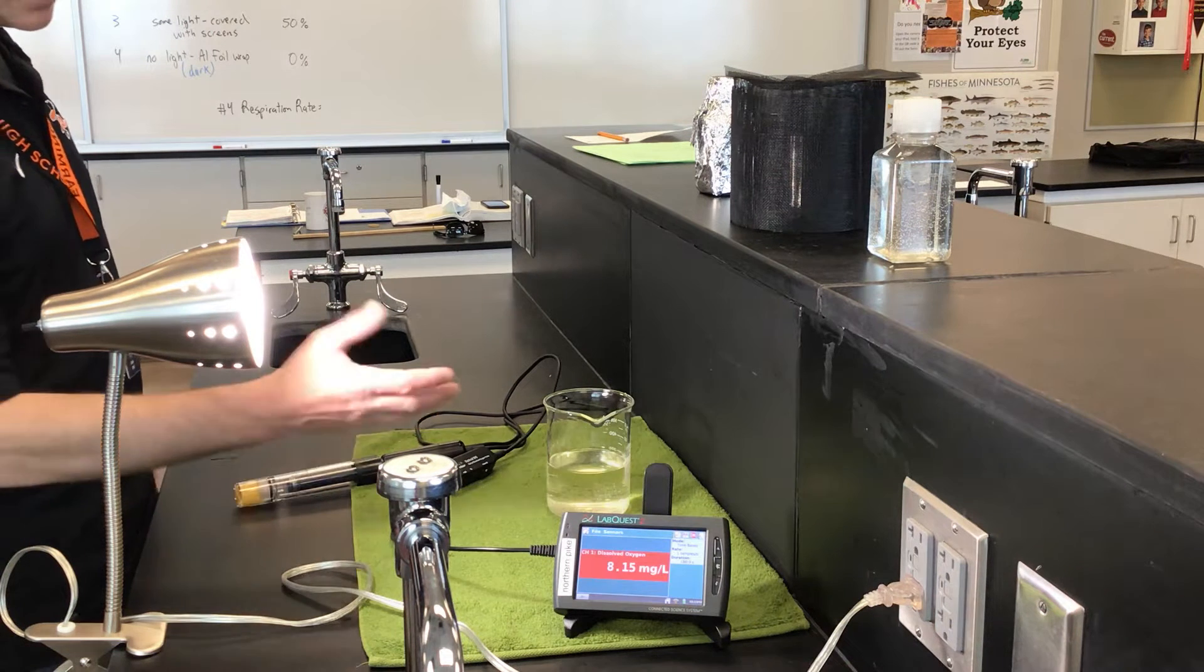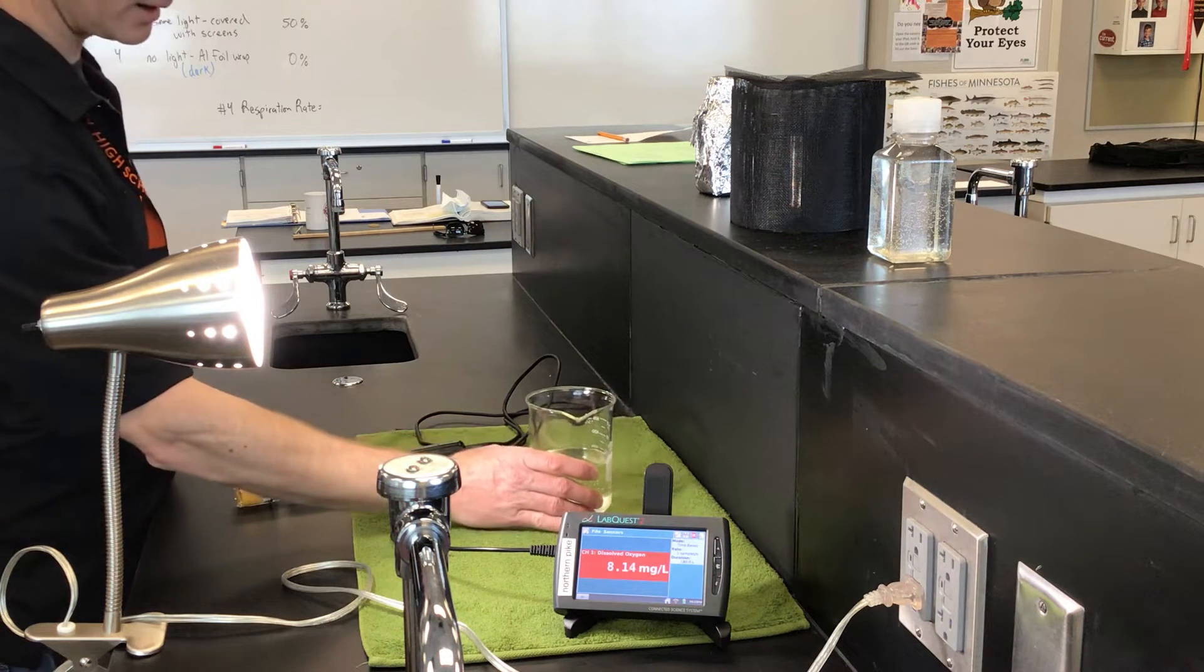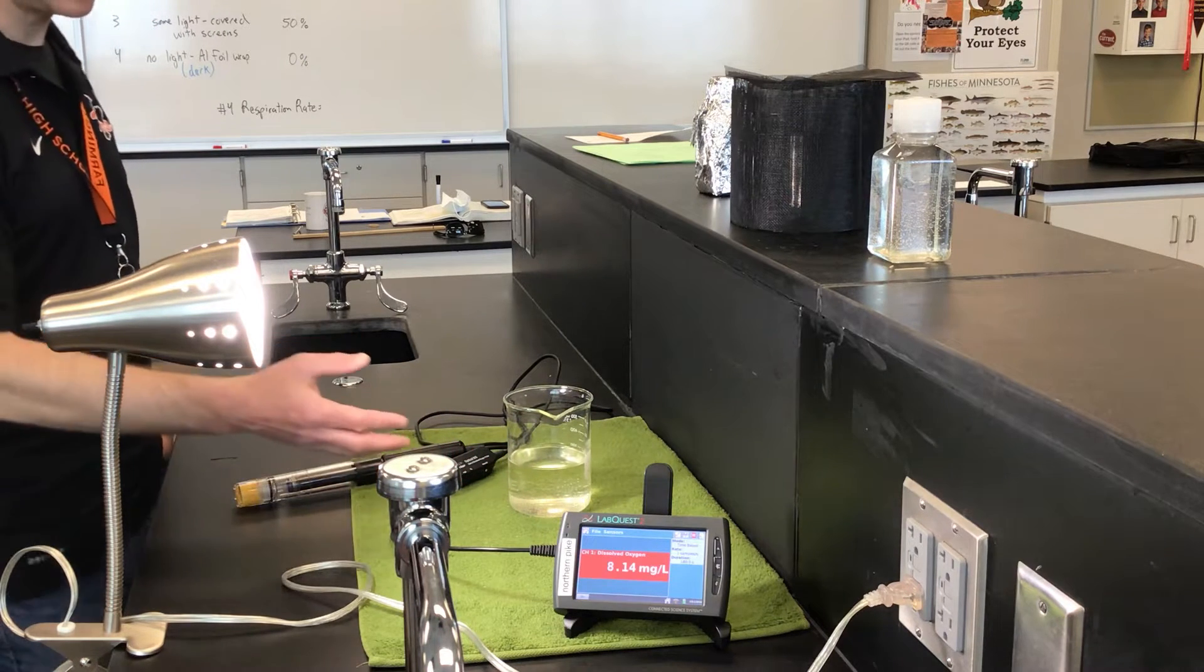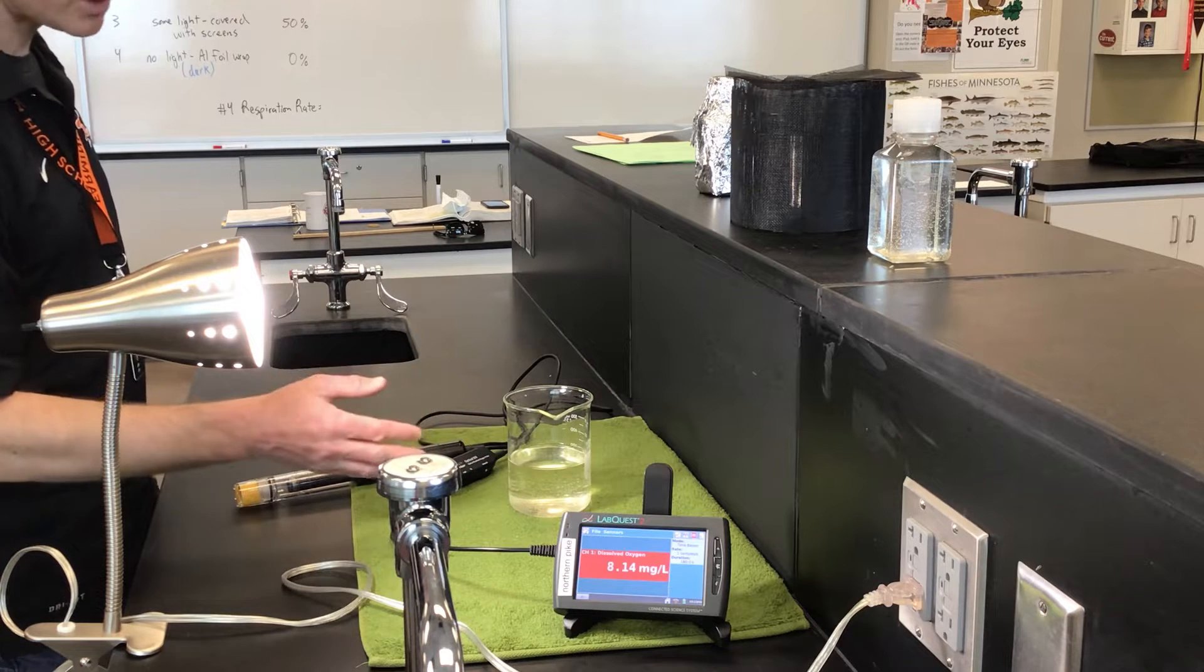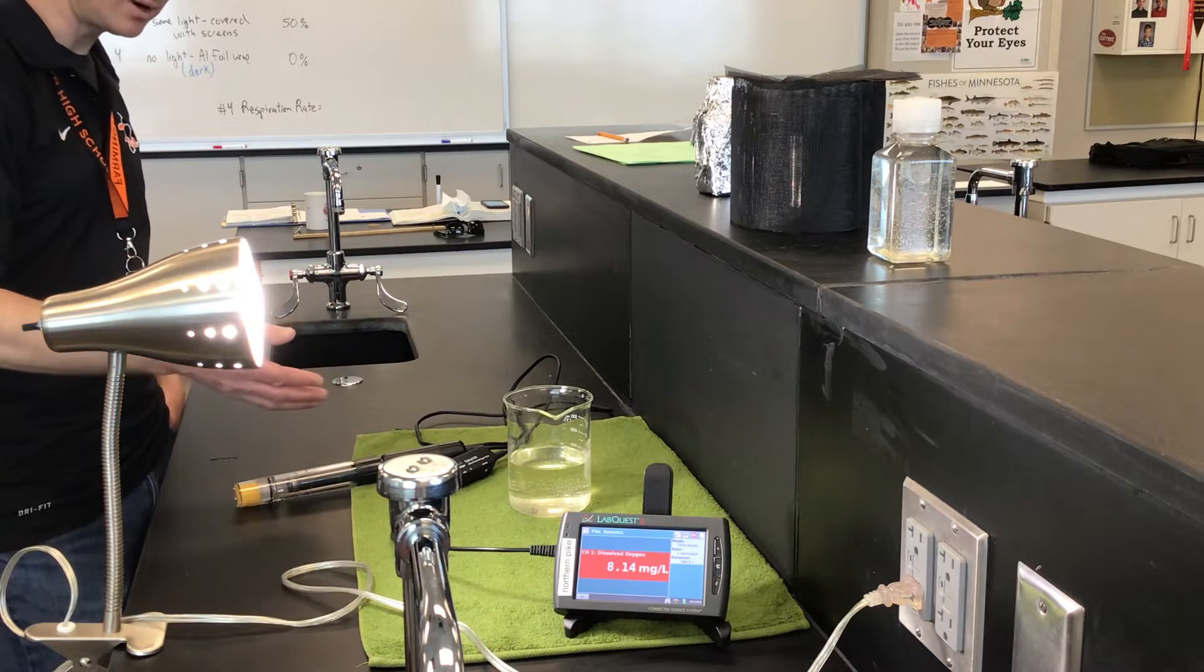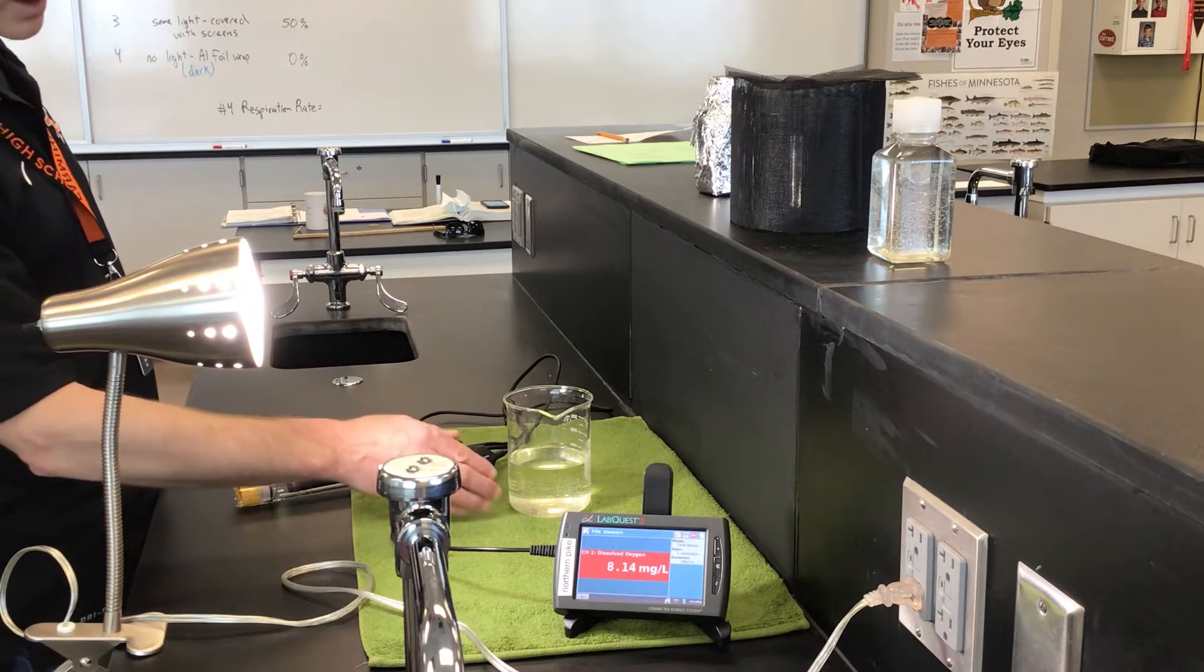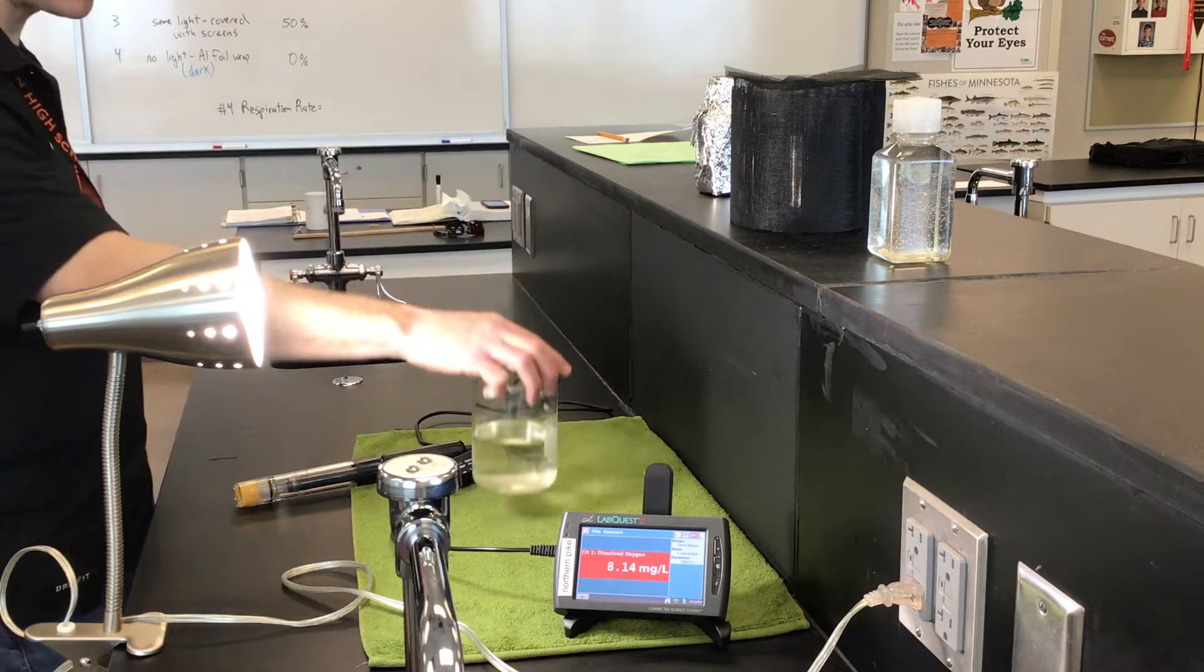So what I did is I went to the pond by the high school here and collected some pond water. I wanted to make sure that there weren't any large macroscopic organisms, like things I could see—bugs and such swimming around, no algae that I can see, or aquatic plants.